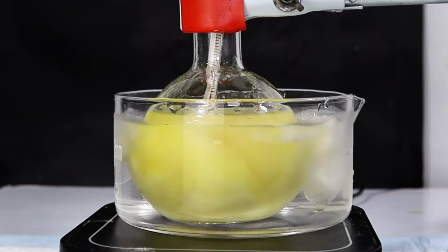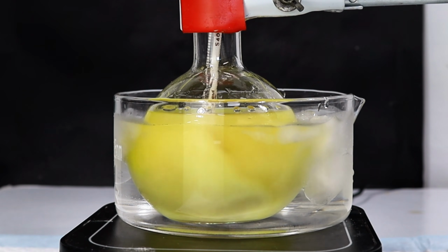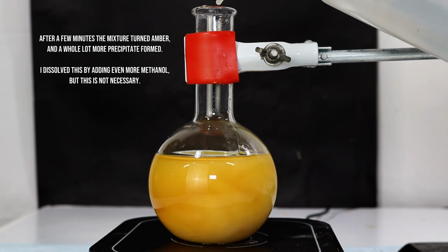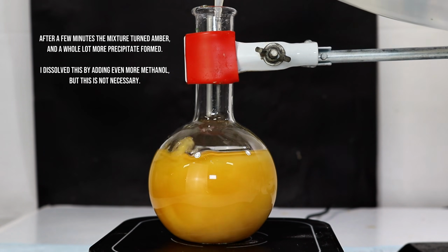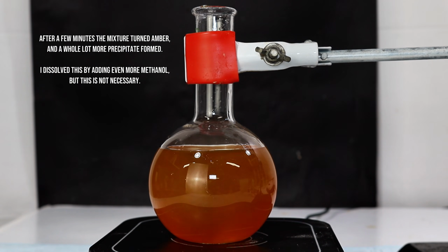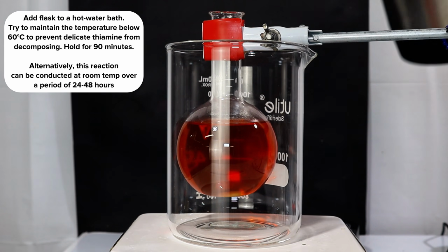After all the benzaldehyde was added, I allowed this to continue mixing for another 10 minutes, during which time the mixture turned an amber color along with a whole lot more of the precipitate. I decided to dissolve this by adding some extra methanol, although I don't think it was really necessary, and then I set the flask up in a hot water bath.